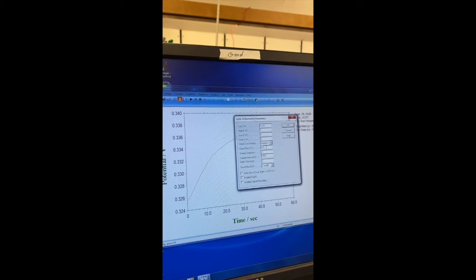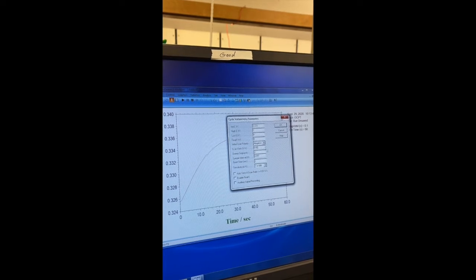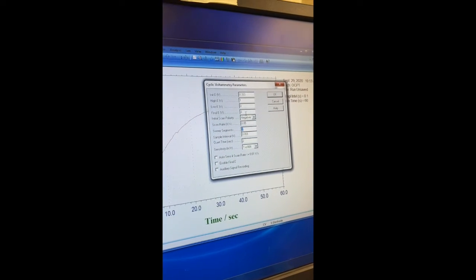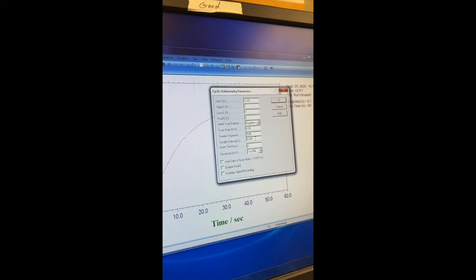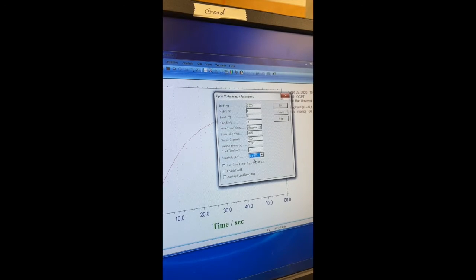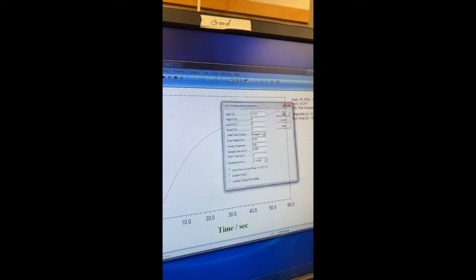We're going to get down to the scan rate, and our scan rate is going to be 0.05 volts per second. Sweep segments here. We're going to actually run this for 30 minutes. I'm going to put 500 in here, but basically we're just going to go for a time amount here. So I'm going to come down to sensitivity, and our sensitivity is going to be 10 to the negative 5. So this is all set up here. So I'm going to click OK.